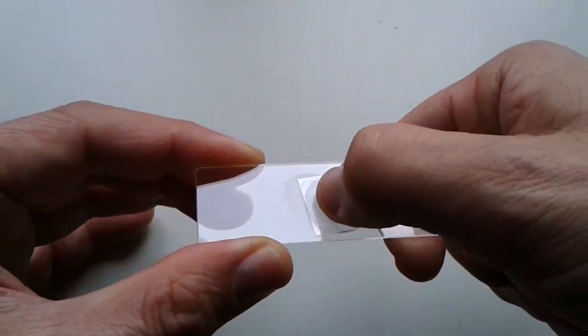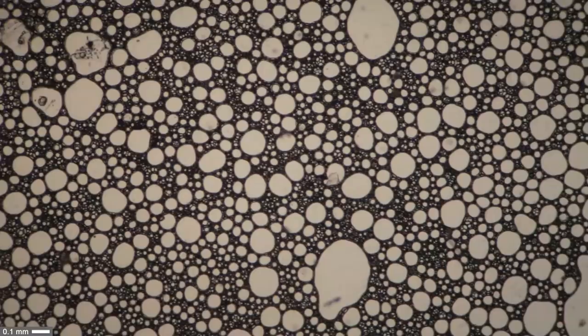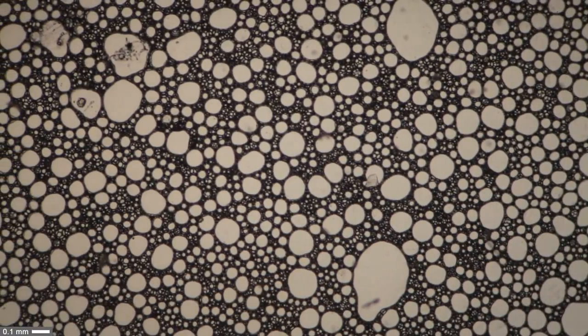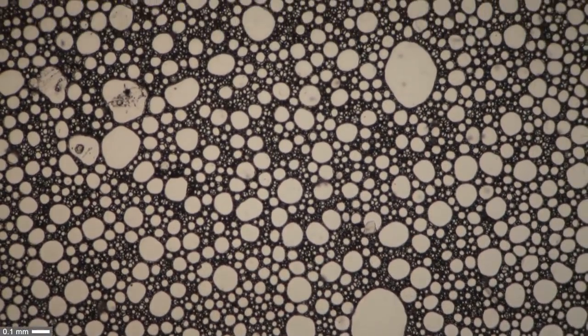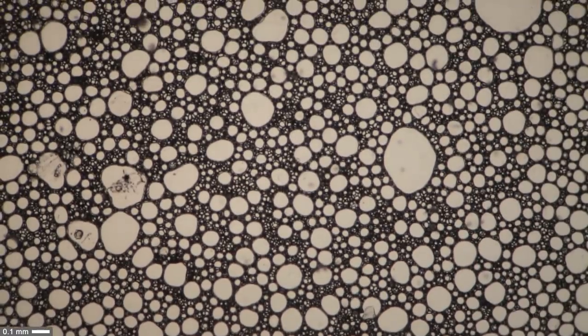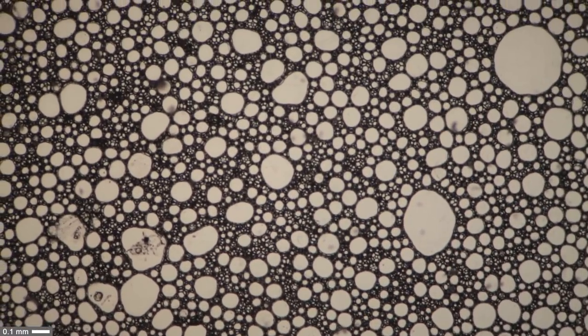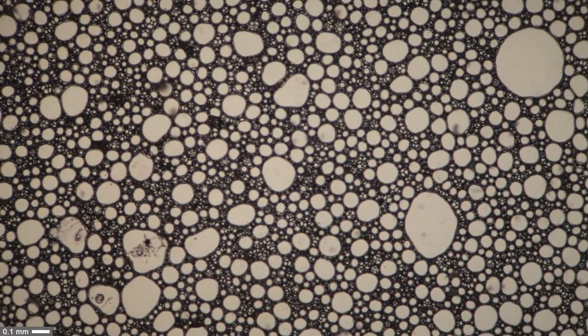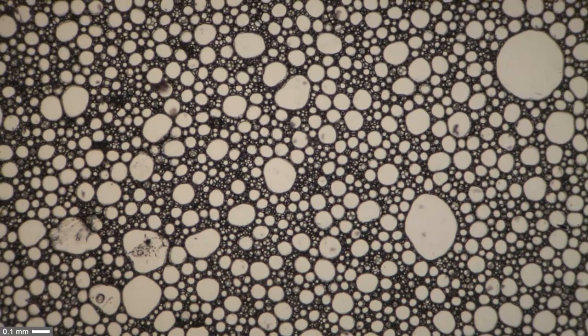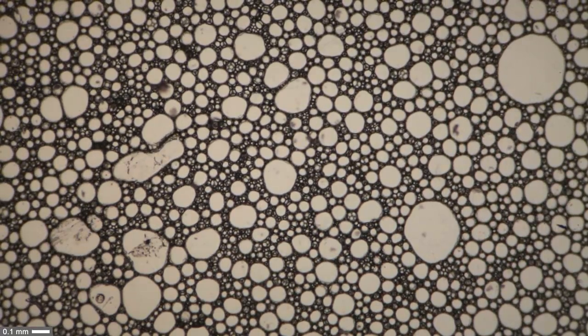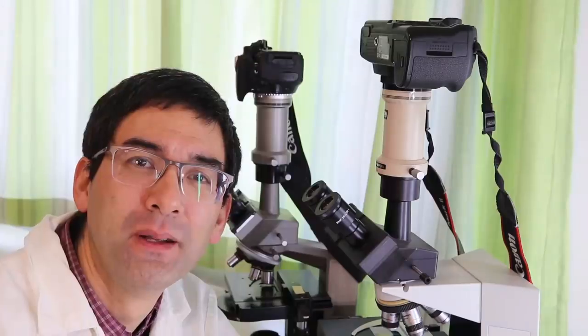I do think that the foam is a little bit too thick, so what I'm going to do now is press on the cover glass. So that is now compressed foam. You see that some of the bubbles are now a little bit larger because I pressed them apart. And that's now one single layer, one layer of foam. And again, a little bit of time-lapse. Well this was quite nice.